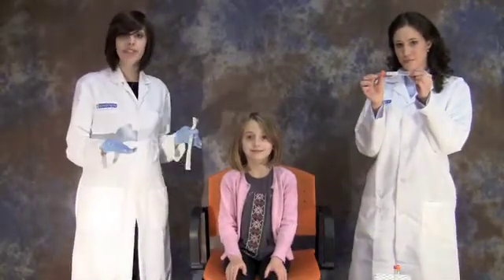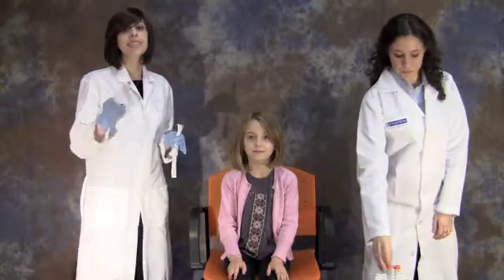Please write the name of the person who is being swabbed on each of the four tubes. If two members of the family have the same name, please indicate their role in the family on the tube as well.